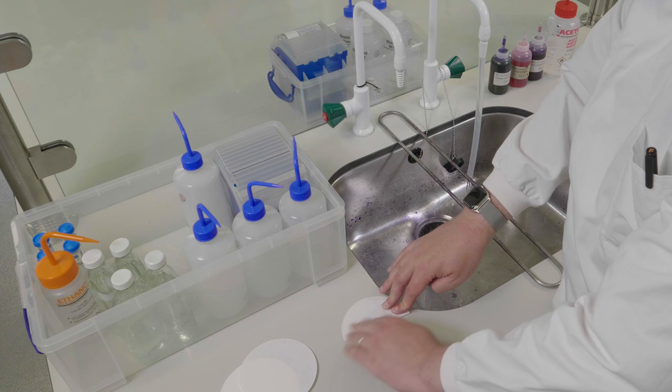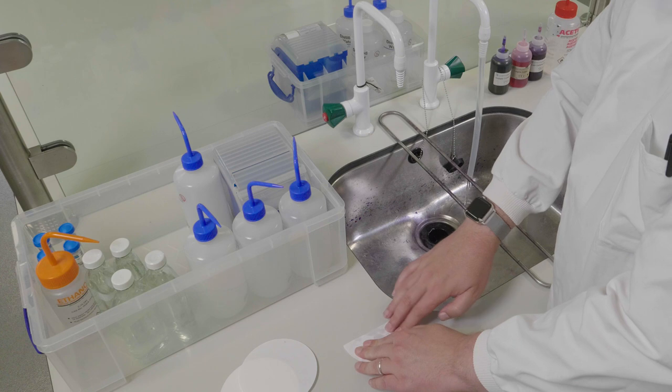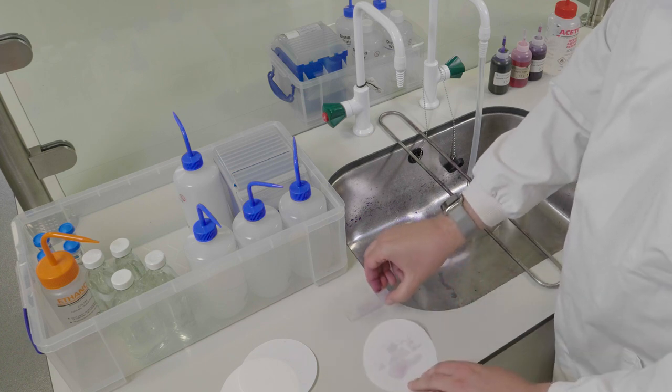Don't attempt to rub the water off, this will also remove bacteria. Once all the water has been blotted off, you are ready to view your stained film under the microscope.